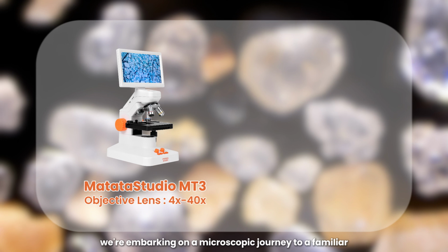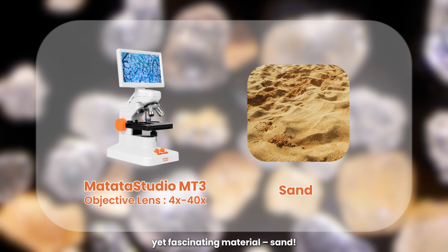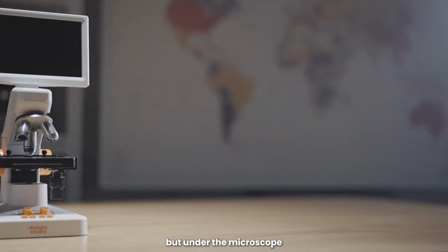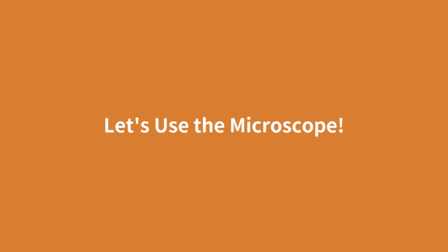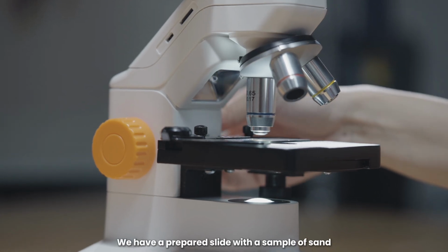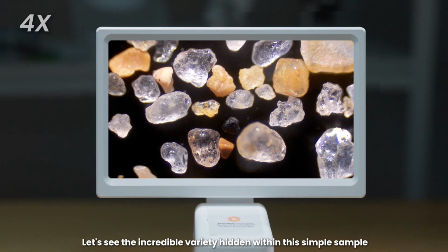Today, we're embarking on a microscopic journey to a familiar, yet fascinating material, sand. Sand seems simple, but under the microscope, it reveals a hidden world of diversity and history. Let's use the microscope. We have a prepared slide with a sample of sand. Let's see the incredible variety hidden within this simple sample.